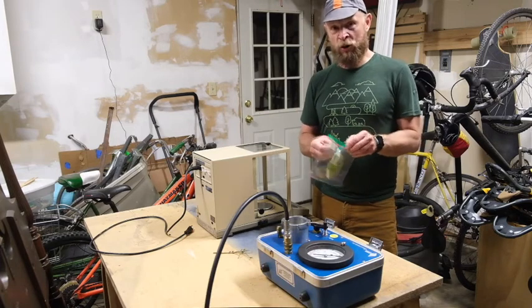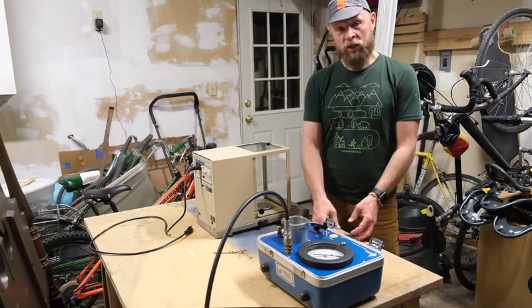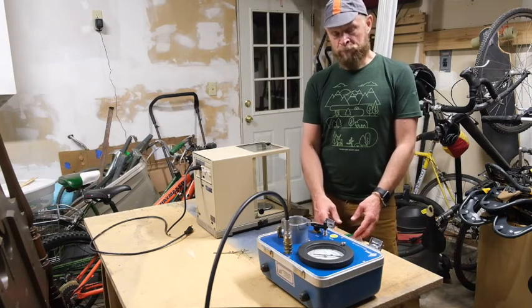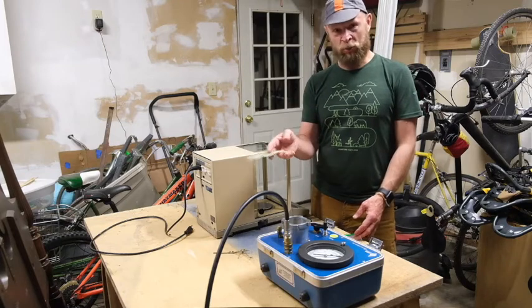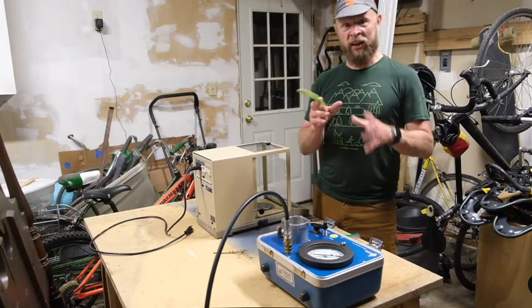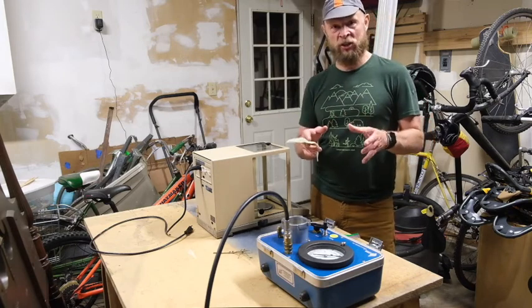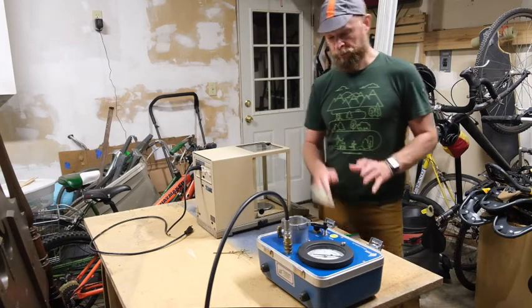Some species though, I would take out of the bag and set them on the bench for a little bit to allow them to dry. And some leaves are so resistant to drying that I actually put them on a fan to dry them out faster. So you really have to get a little sense of the species you're measuring before you get into measuring a pressure volume curve.